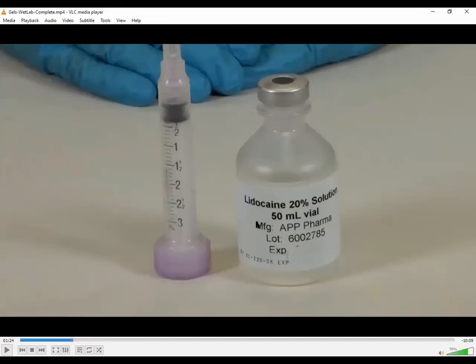Now, because I didn't want you guys leaking with the injectable, I've gone ahead and opened up the injectable bottle here and poured it out. So this is just in one of my plastic containers. Just take off the green lid and you're going to suck up 1 milliliter. To do that, you're going to use a 3 milliliter syringe. That's what the 3 milliliter syringes are there for.